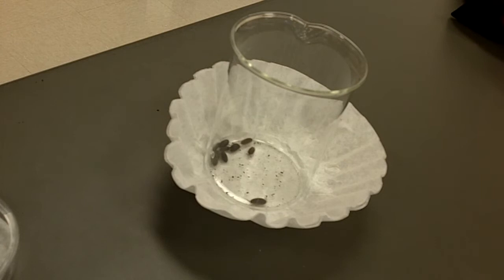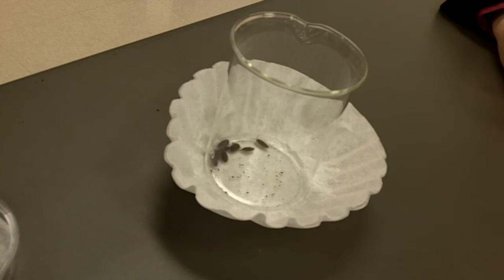What colors do you see on yours? I have light browns, gray to maybe a dusty looking black, and some browns and tans. Some of them are kind of mottled looking and some are more solid looking. Some of it you could visually describe and others you would want to make sure you're citing it.